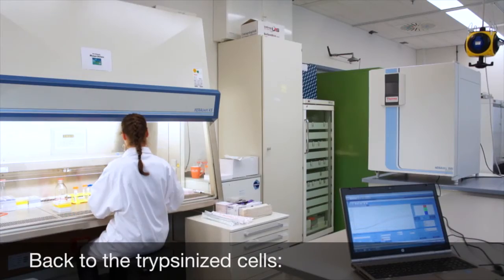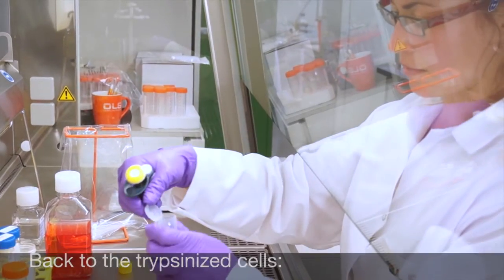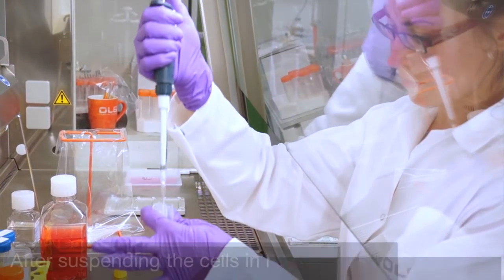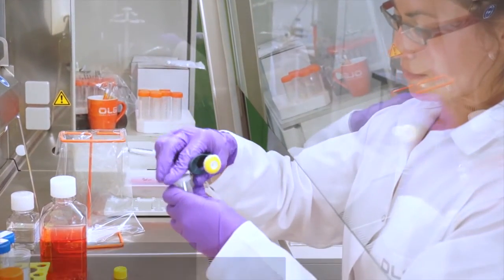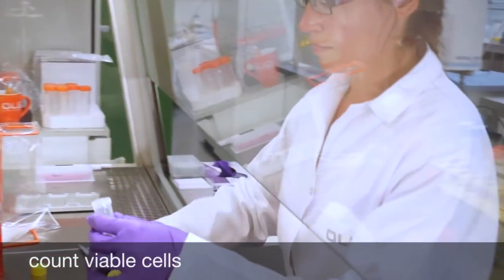Resuspend the detached cells in medium and determine the number of viable cells in your preparation. Make sure to perform an accurate cell counting since a correct seeding density ensures optimal results.